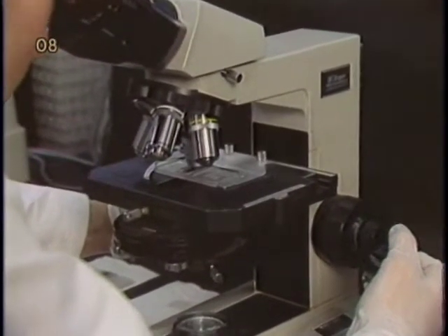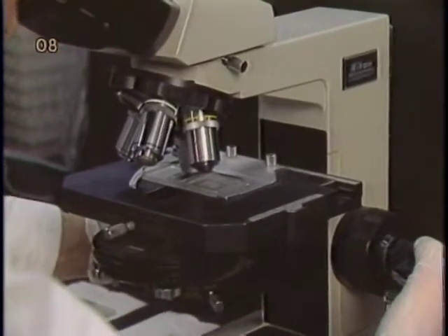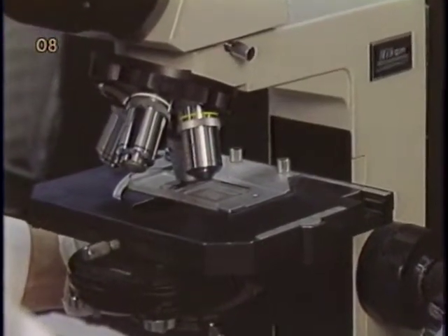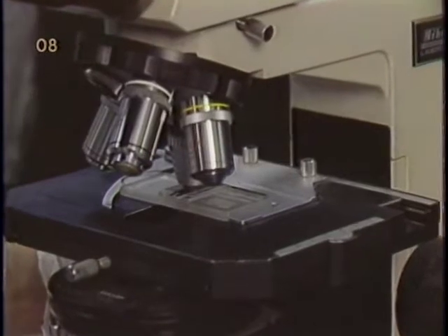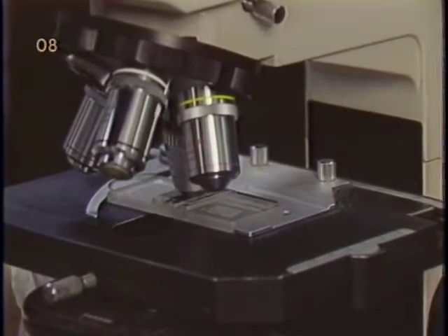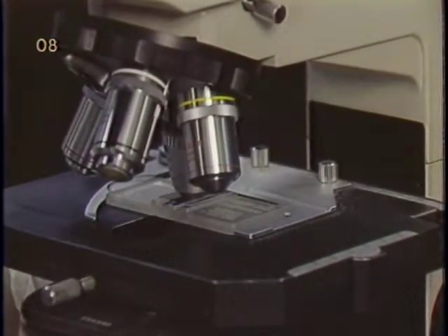A question that needs to be addressed is how much counting solution should be added to the packed microcarrier beads. In general, a constant volumetric ratio of counting solution to the packed beads should be maintained.